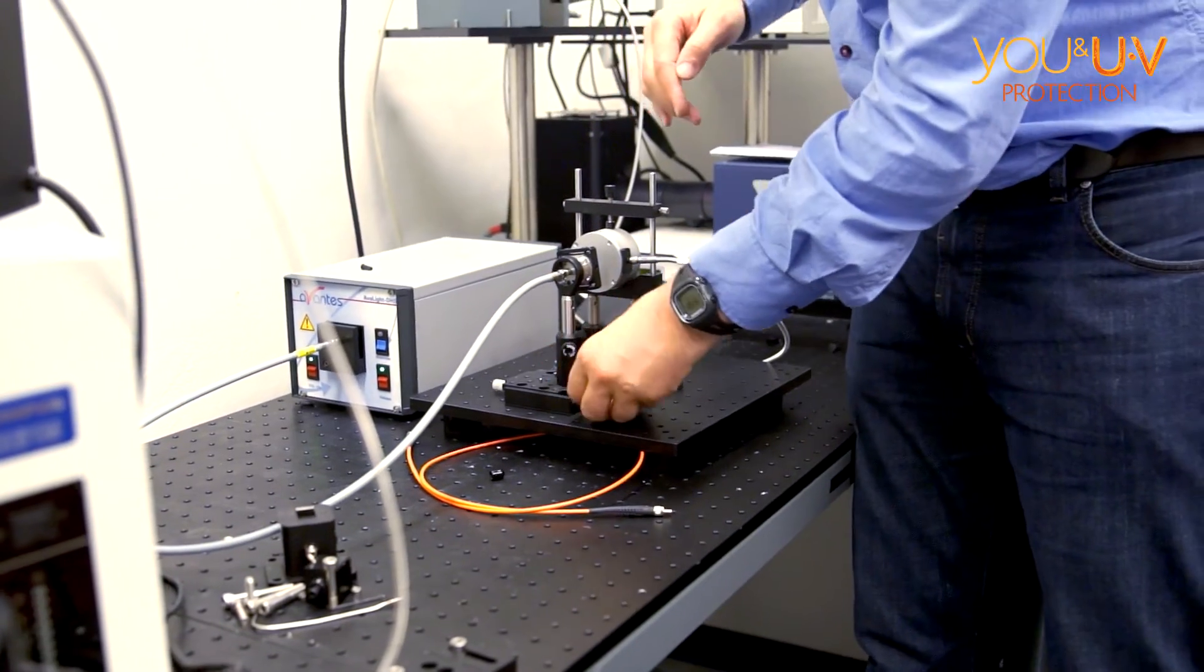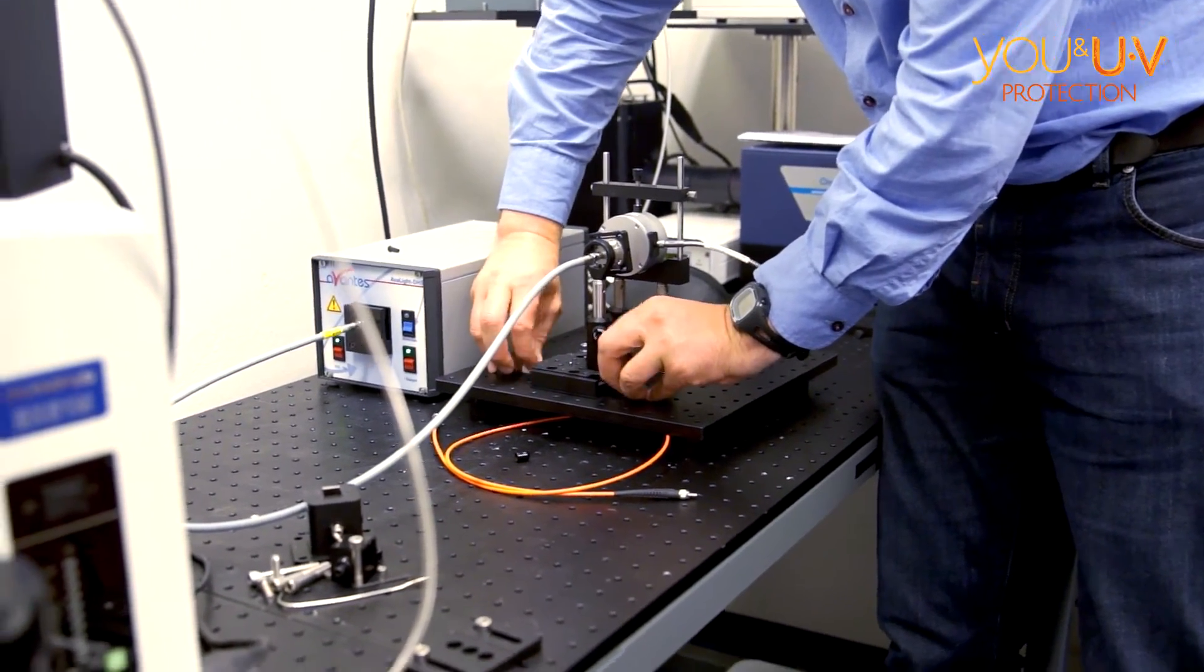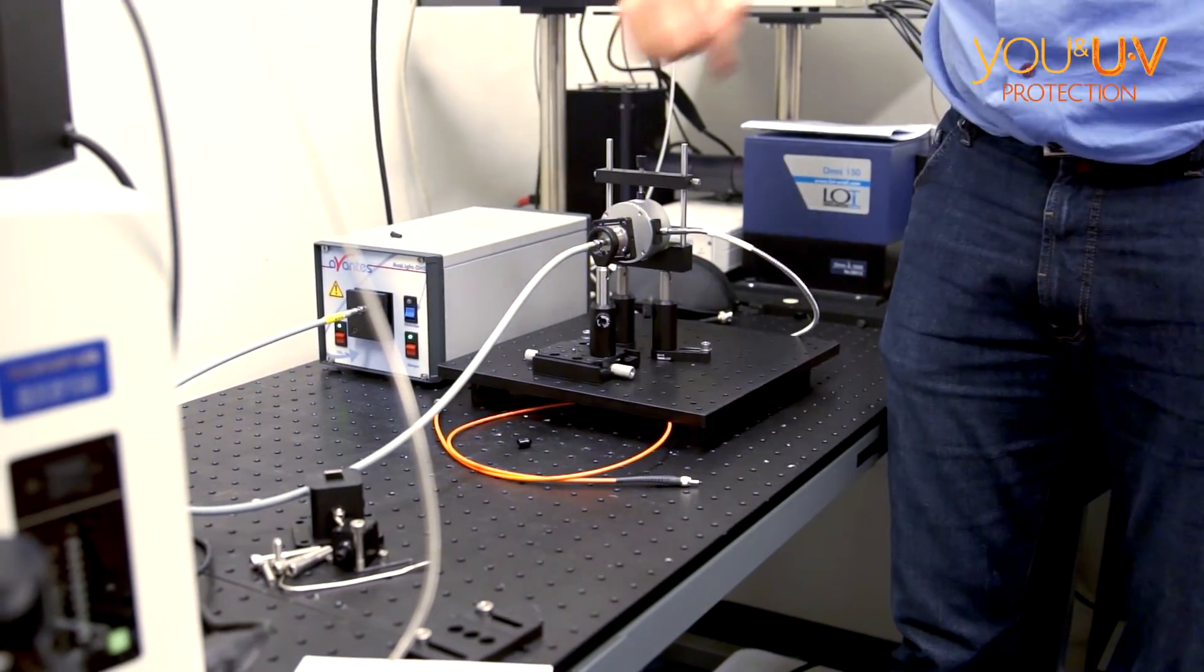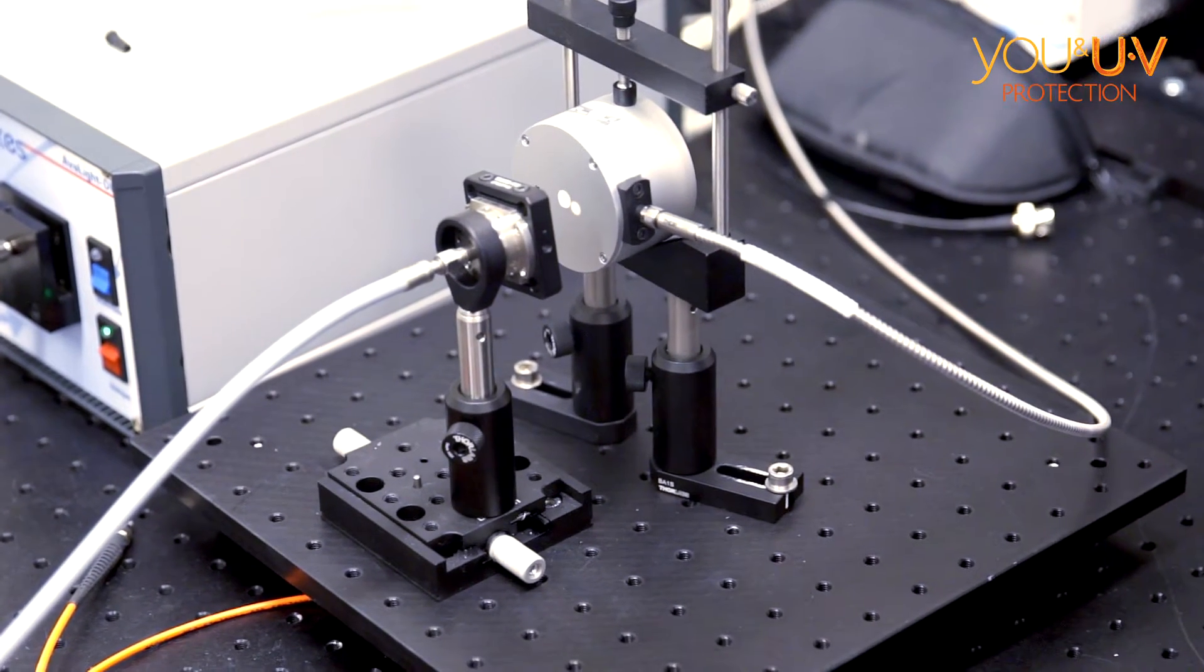Now I have visible light here. If I move this over—this is just a stage—you can see a small dot there. Now we want that light to go straight into the hole.